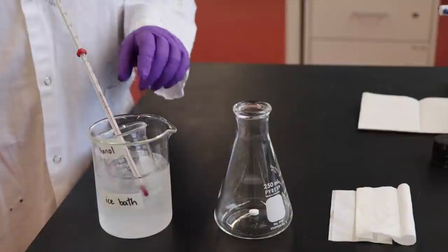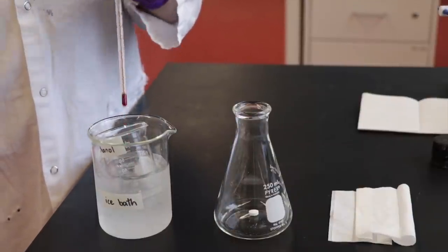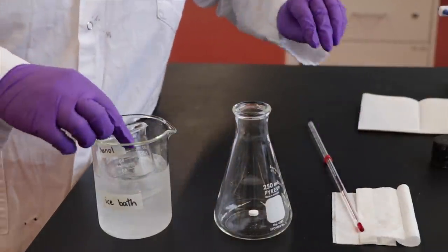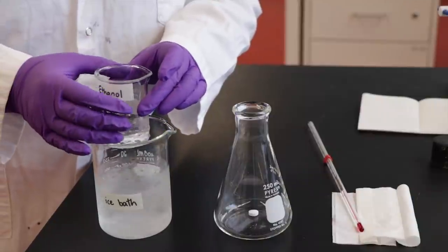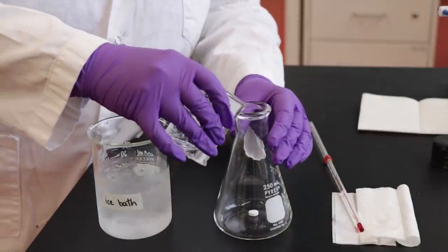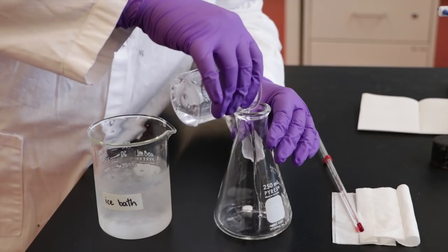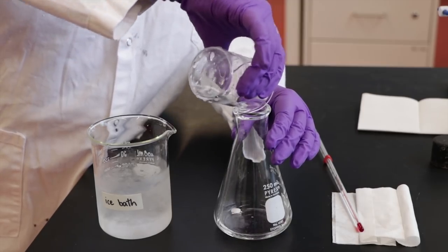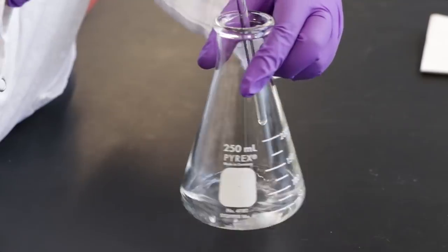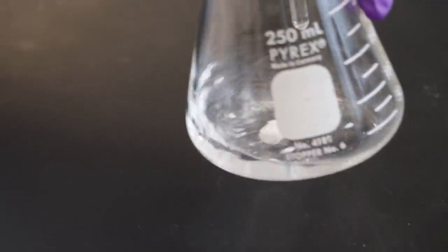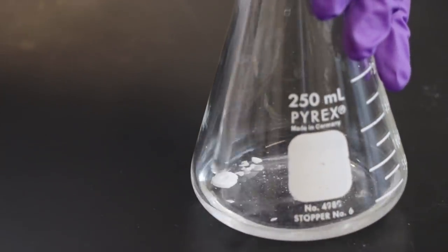Next, add about 25 mL of pre-chilled 95% ethanol into the Erlenmeyer flask. The ethanol should be cooled to about 15 degrees before addition. Swirl the flask until the tablet dissolves. You can use a glass rod to crush the tablet to speed up the dissolving.